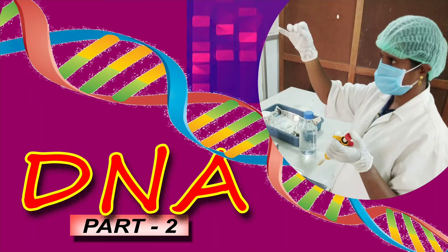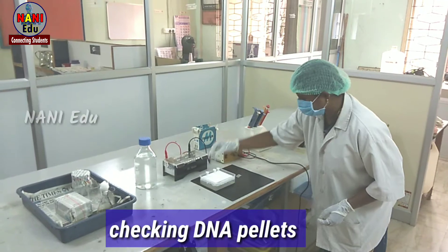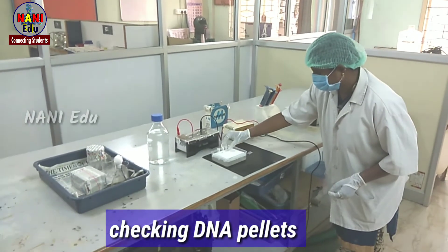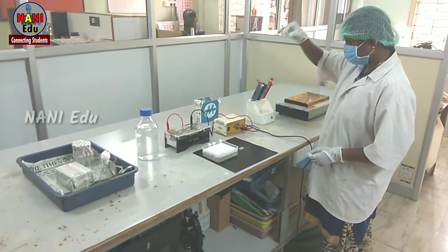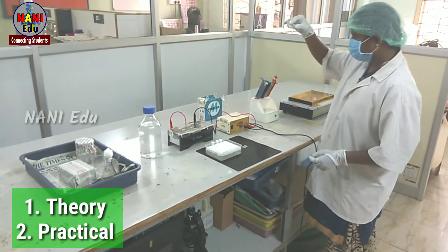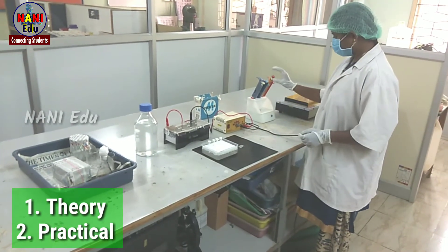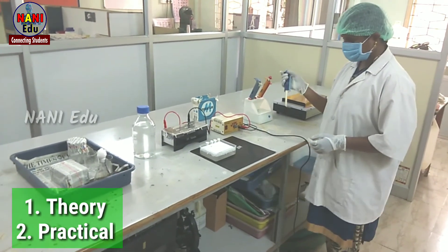Hi friends! How are you? The most important topic for all the students and for all the departments: Isolation of DNA, isolation of the plasmid, isolation of DNA from the tissues. This is one procedure. We will skip and talk about theory, demonstration, and practical live.